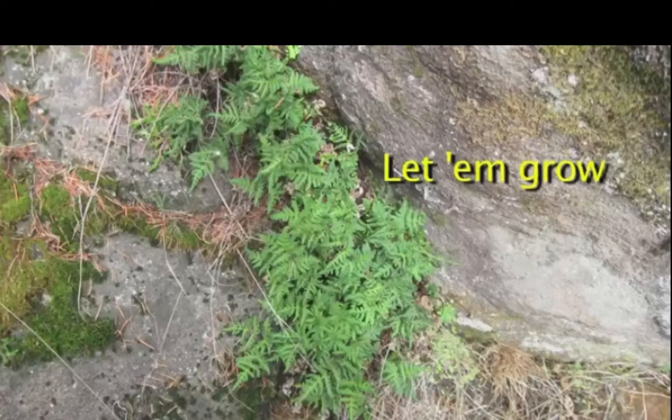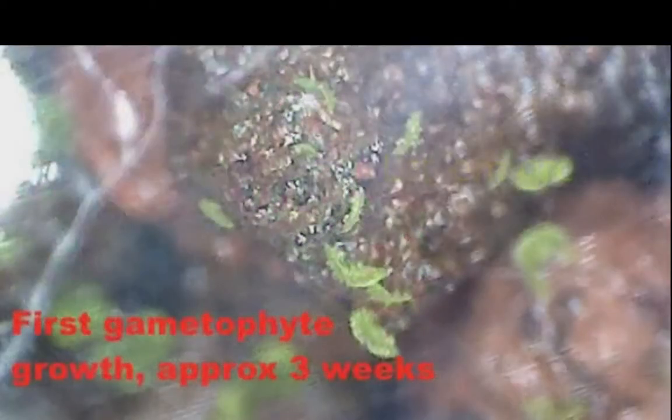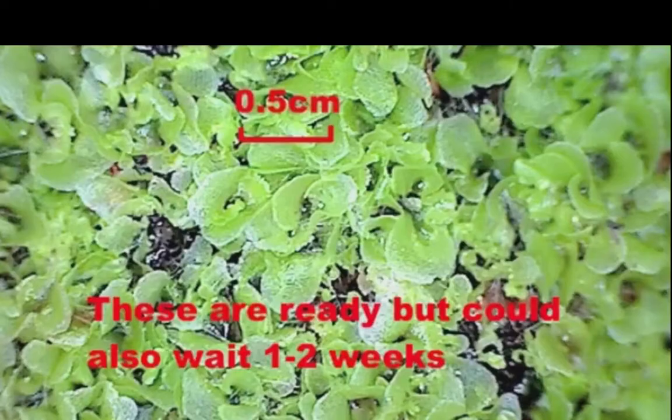After sowing, place the Petri in the light and let it grow. In a few weeks, you should see some green, and eventually the gametophytes should cover the surface of the Petri. Ideally, when the gametophytes get big enough to touch each other, they are between 1/8 and 1/4 inch in size. But even without this optimum density, you can still successfully grow ferns. This stage can last from 2 to 6 months, and you may have to open the Petri in order to add water or deal with other problems. Wow. Check the website for helpful hints on this stage.